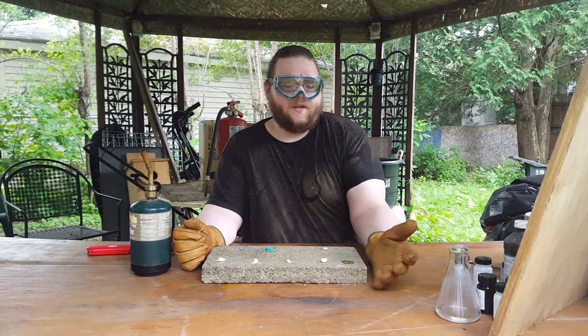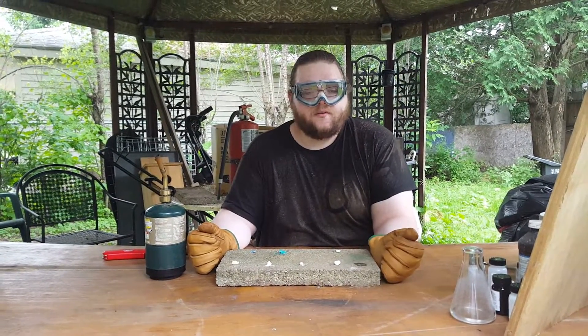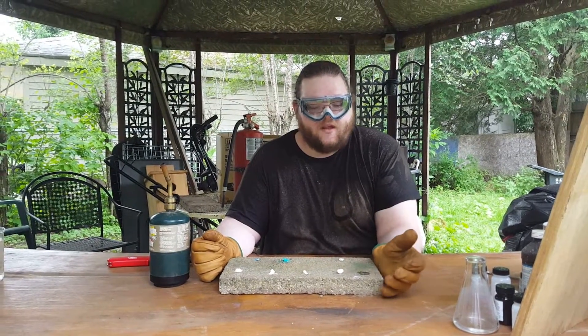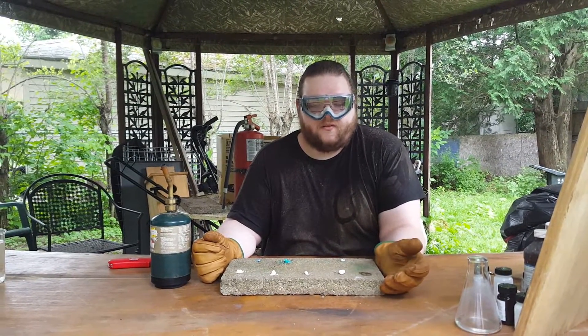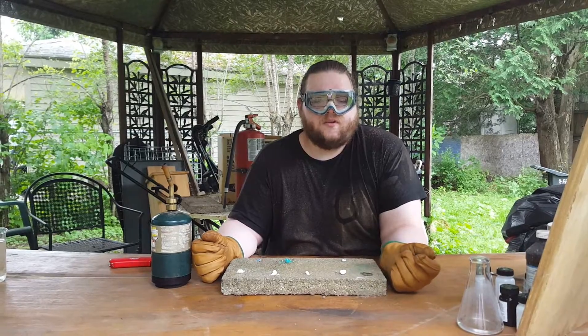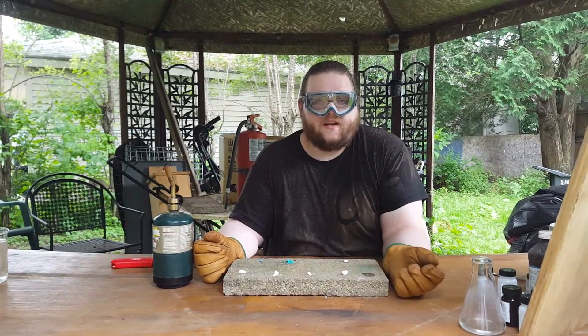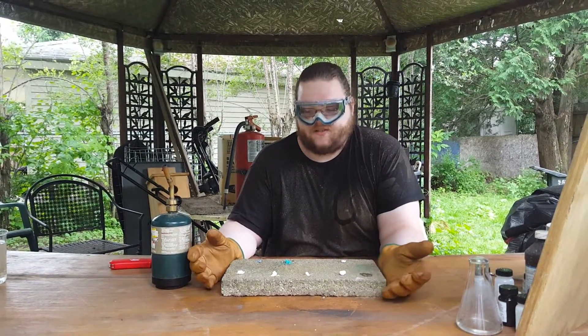Hello, I am William Yates, and today we are going to be performing an experiment. This experiment is called a flame test, and it is used to determine which metallic cations are in which substance.